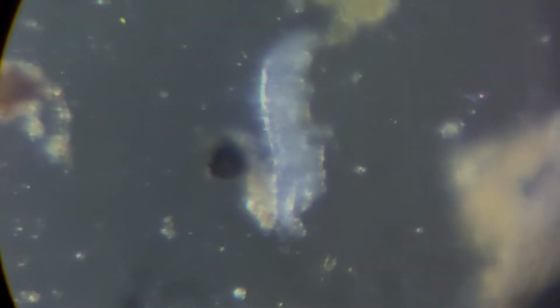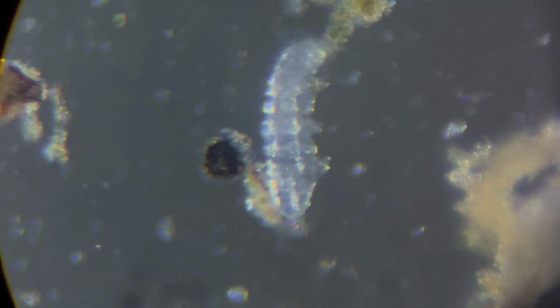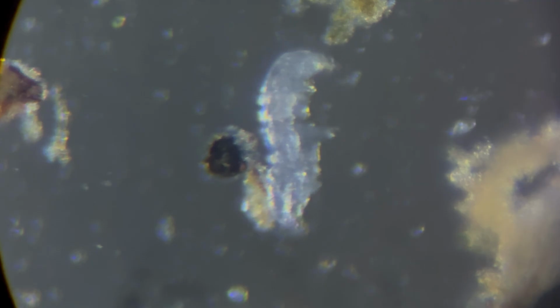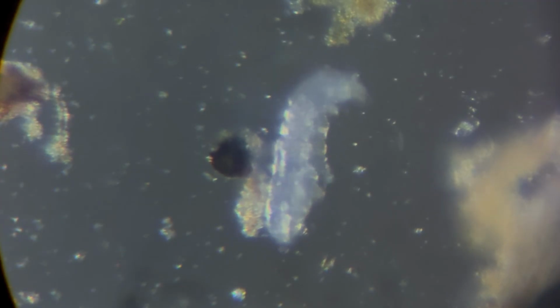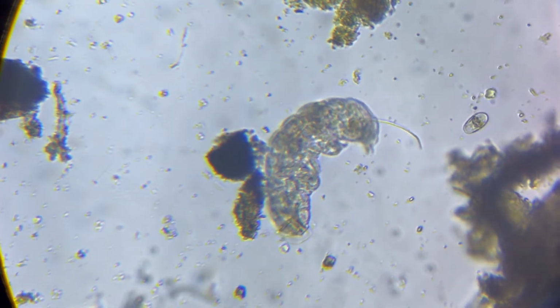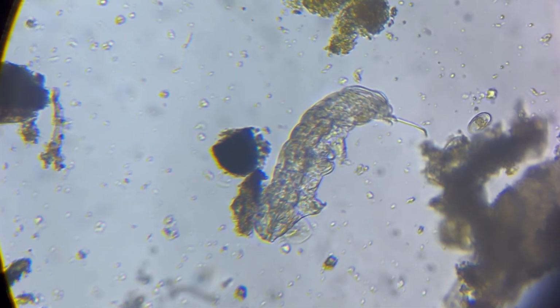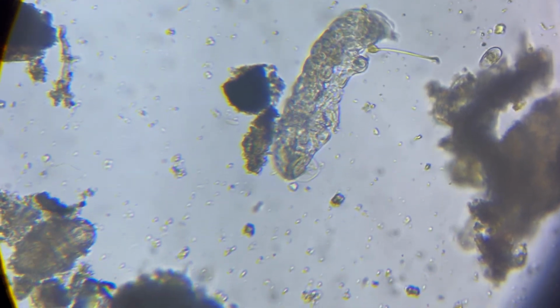And what I did was I swapped the microscope settings to look at it using a more traditional method. So we're looking at the tardigrade as it would look to your naked eye, not with the light passing through it. So the light is bouncing off the tardigrade, and you can see just what it would look like if you had an eye that was powerful enough to see a tardigrade. It was completely transparent. Now, switching it back to the more typical way of using a microscope, where the light passes through the little tardigrade, you can see the intricacies of its little digestive system.